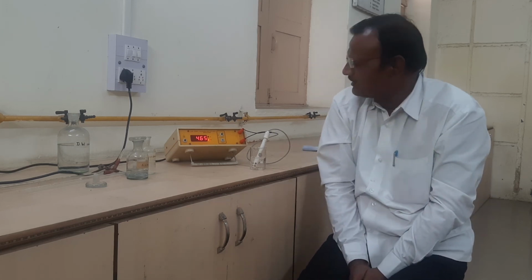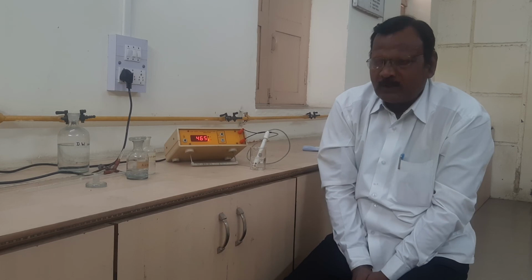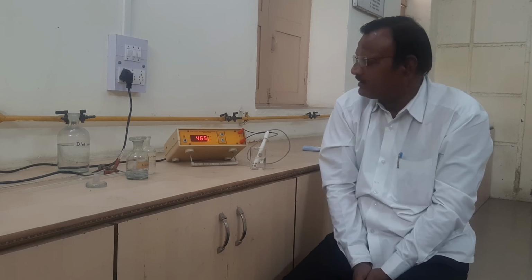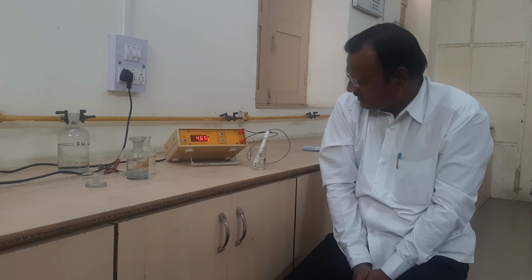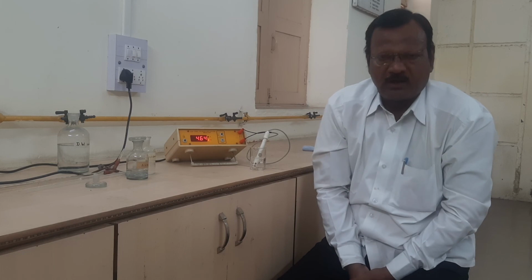After completion of this titration, both equivalence points will appear, one from the strong acid and the other from the weak acid, by the addition of strong alkali. The experiment is conducted as the complete titration. Then we have to stop the readings, and we have to represent our observations.